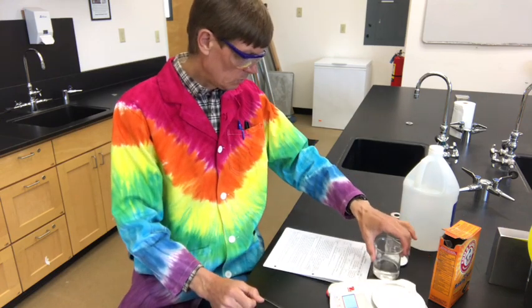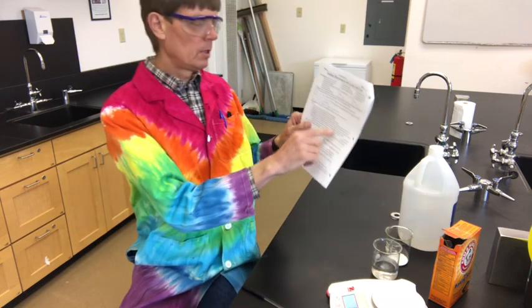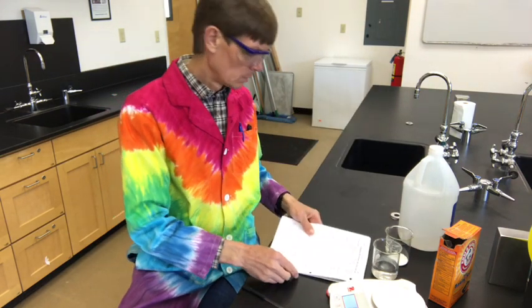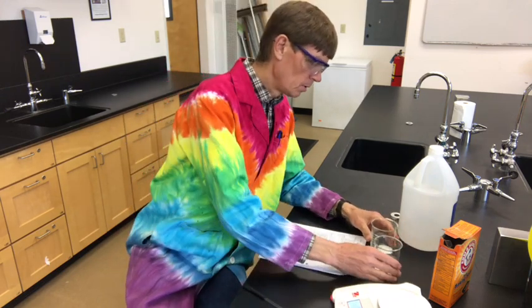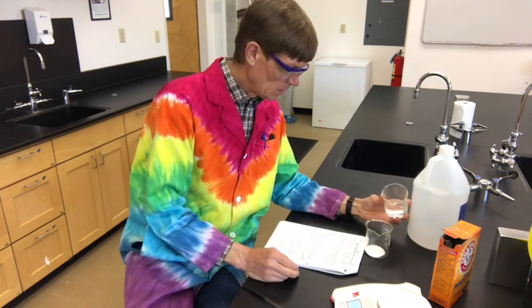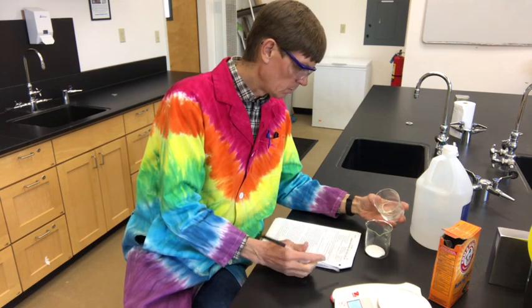Now, it says to mix slowly. By the way, you're going to put each of the individual masses here and then put a total over here. So it says to mix slowly, and that's exactly what we're going to do. This is the same one we had for the hot ice, and it's so easy for it to be boiling over. So I'm not going to talk while I'm stirring so that we can speed up the video.